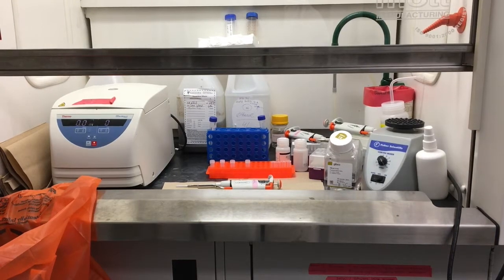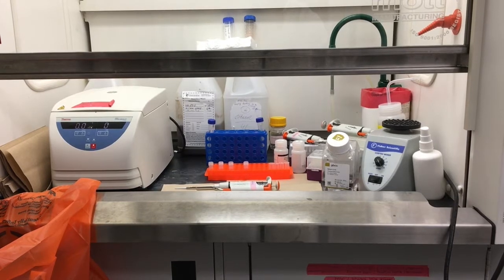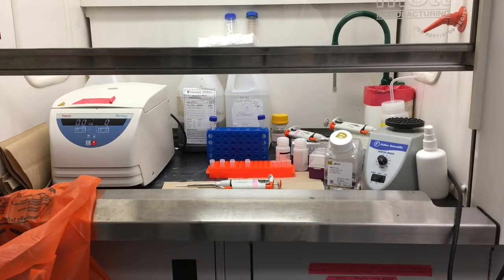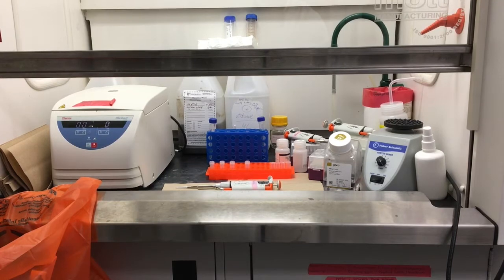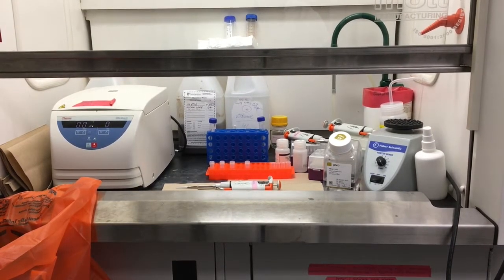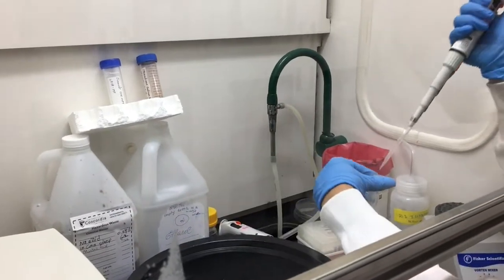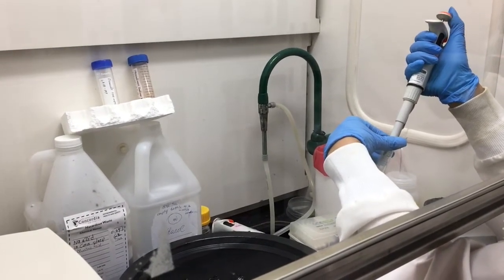Hello 515 students. This short video will show RNA extraction from yeast. In the last video, we cultured yeast in growth media that had either glucose or galactose as a carbon source. We will extract RNA so that we can perform transcriptomic analysis and compare gene expression in yeast grown in either condition. We will show you the steps to isolate yeast RNA using the QIAGEN RNeasy mini kit.